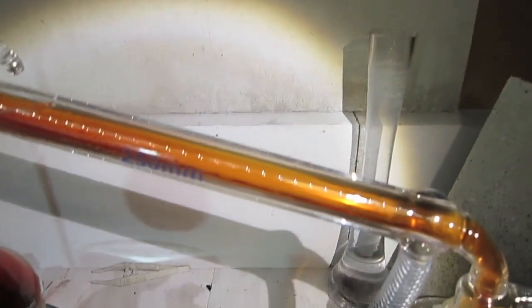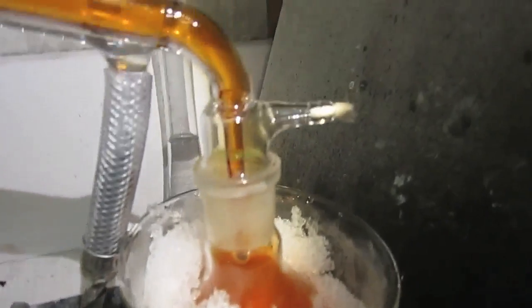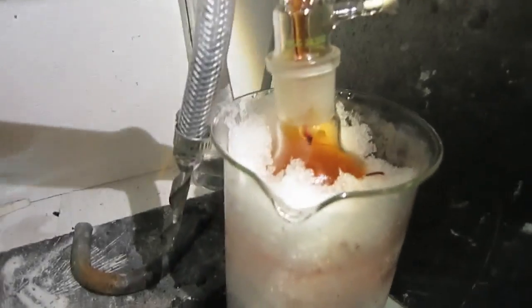Sometimes even dripping down from the receiver—dripping down some bromine. Now it's dripping into the receiver, into the ice-cold glass.